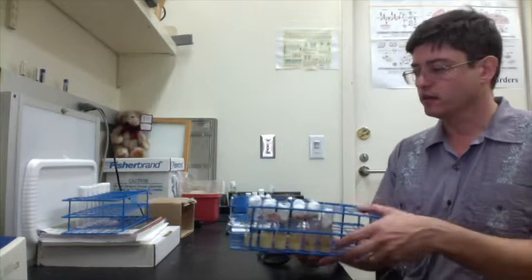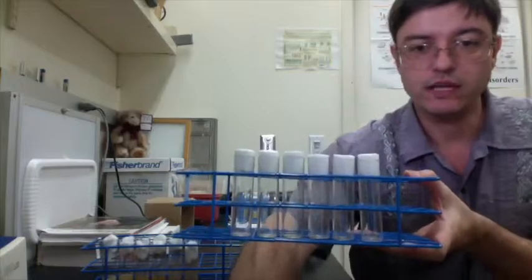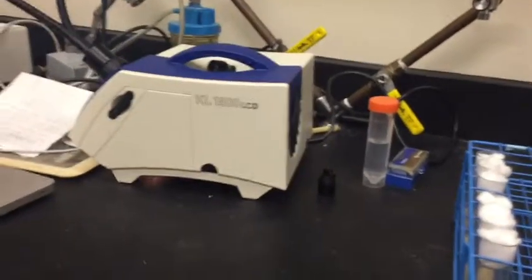So what we have here are 6 different genotypes of fly, and we're going to compare how well they climb. And the way that we're going to do that is by setting them into these empty tubes and then performing the geotaxis assay on them all together and videotaping it. And then that video will be analyzed by the Flytracker program to produce statistically significant results about the climbing abilities of these flies.